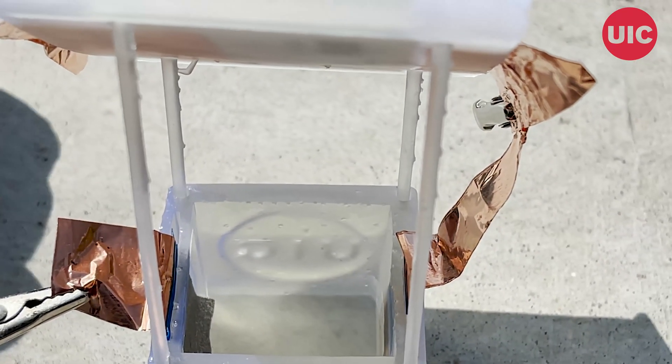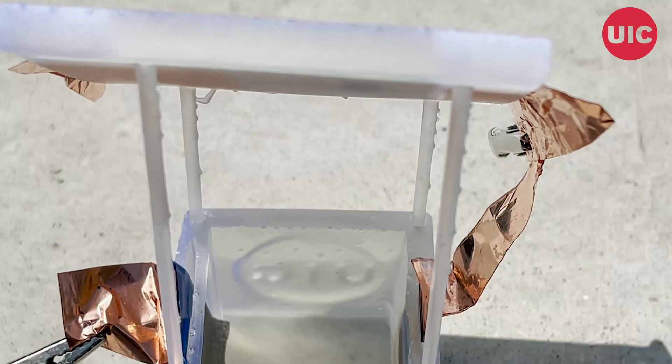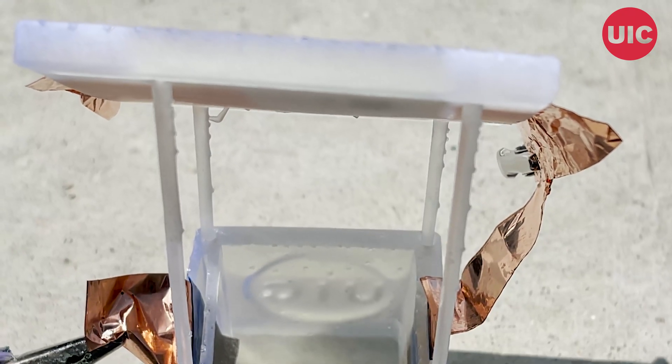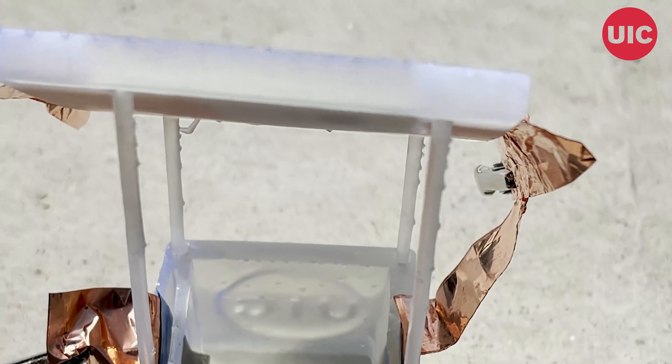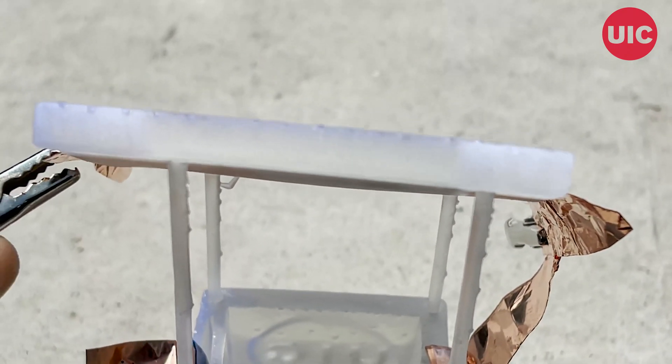This is the reactor, and I'm going to now connect the terminal of this reactor to the solar panel. As soon as I connect it, you will see the reaction starting spontaneously.